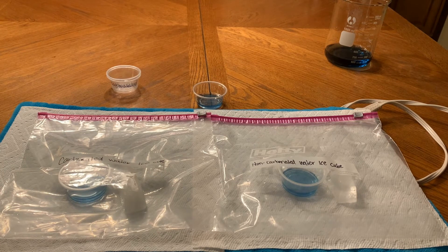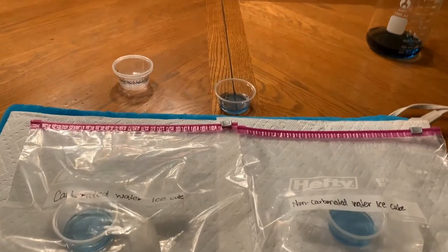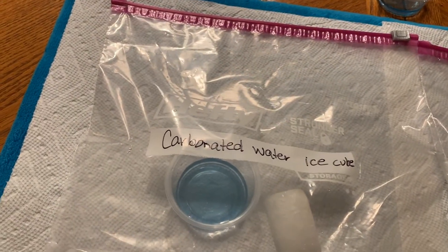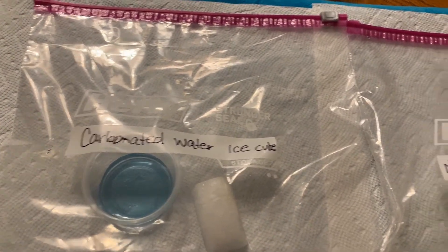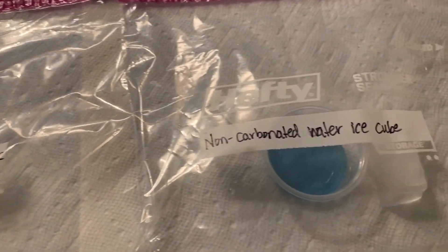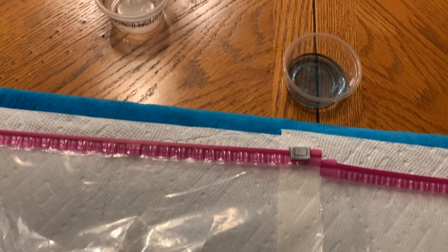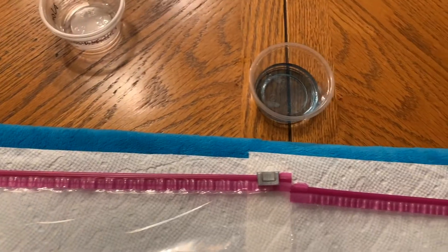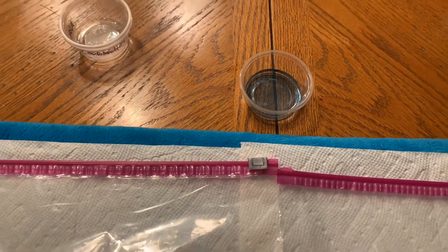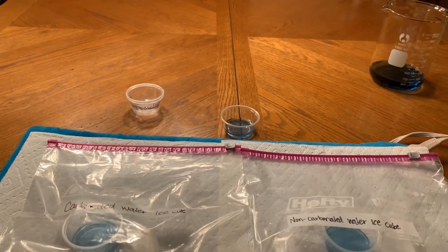To start, we'll zoom in a little to record the color of our BTB in the carbonated water baggie, the BTB in the non-carbonated water baggie, and then the BTB out in the classroom where you're doing your investigation.